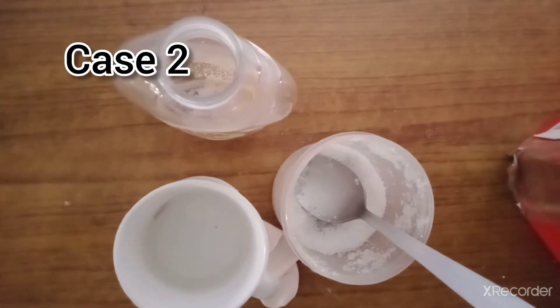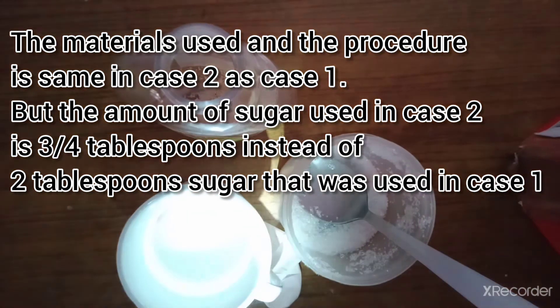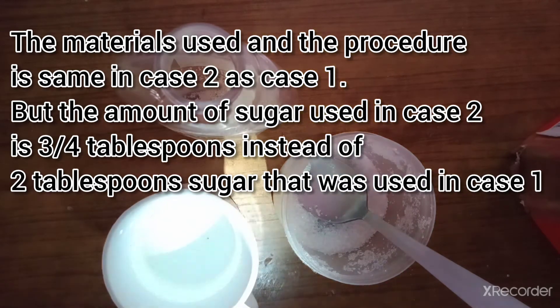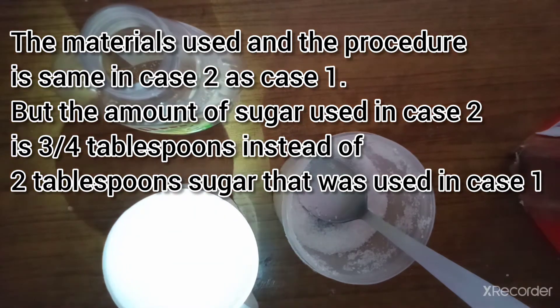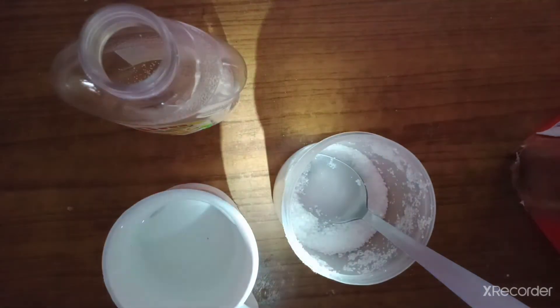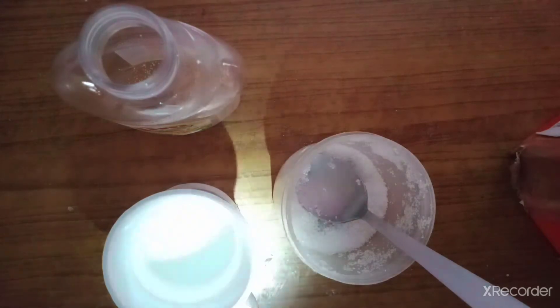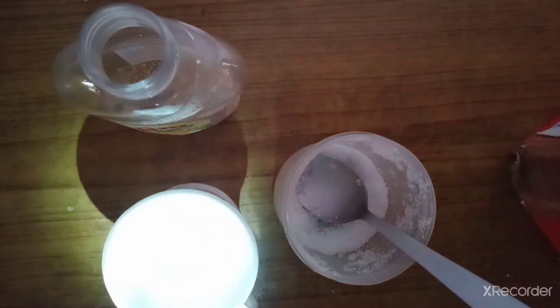I am back with Part 2. This time we are using the same materials but with one difference: in Case 2, I will pour the same amount of yeast and an equal amount of water as in Case 1, but I will pour only a little amount of sugar. I will watch the reaction after 60 minutes, just like in Case 1.